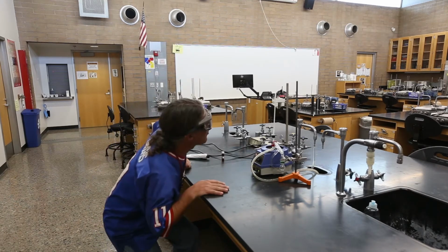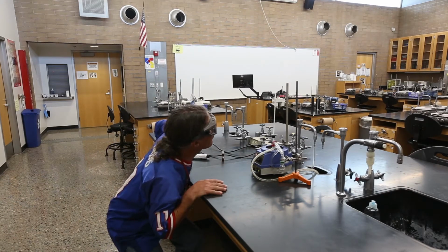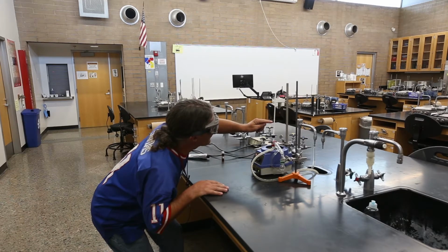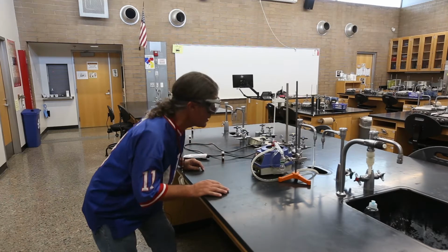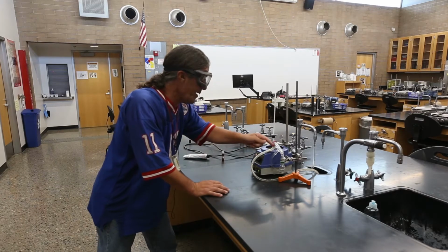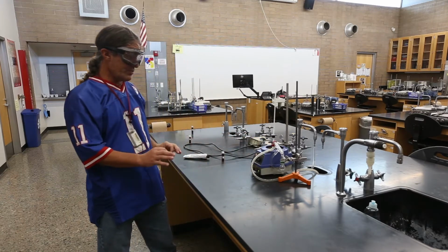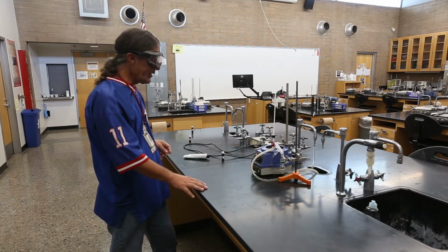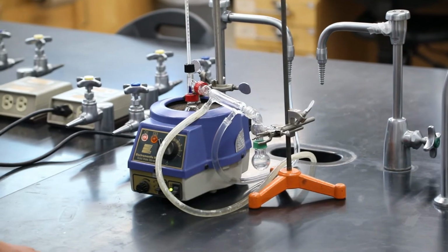So if I'm seeing this boiling, and it is happening right at 66 degrees, this temperature is not moving at all. It's just sitting there right on 66 as drop after drop comes through. So it looks like this is nice pure hexane. It's distilling smoothly and collecting at a nice rate.